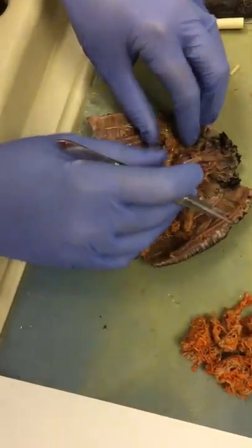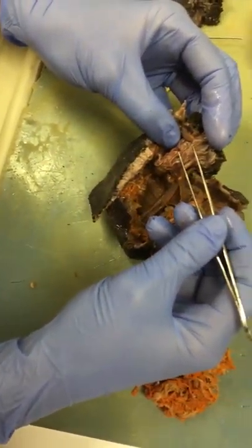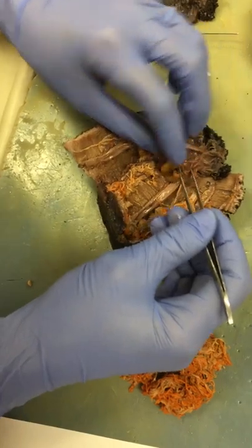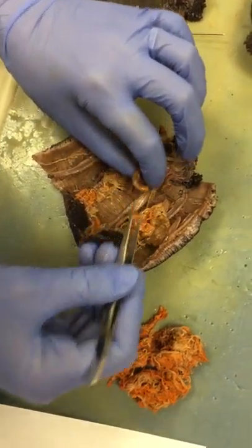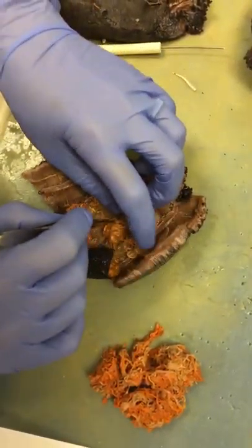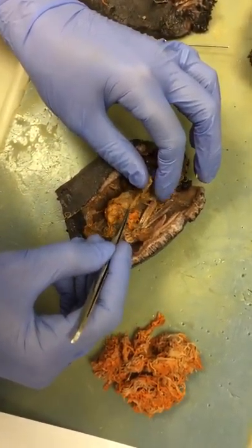If we continue on, we've got the mouth right here, the tentacles, this is the pharynx bulb — also known as the pharynx — that leads to the esophagus, which is the next part, and then to the stomach, which is this region right here. From the stomach, it's going to be attached to the intestines, and some of these have kind of been broken off, but we can see some of those intestines connected by some mesentery.